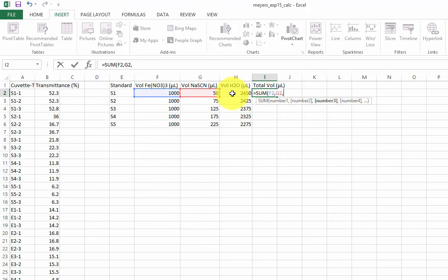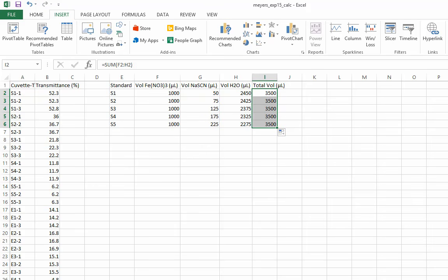You can separate the cells with commas, or box them all at once. This formula can be carried to each cell like I did before. In order to calculate the concentration of iron thiocyanate, I need to use the concentration of sodium thiocyanate. I'll list this value above the table, but I need to make some space first.